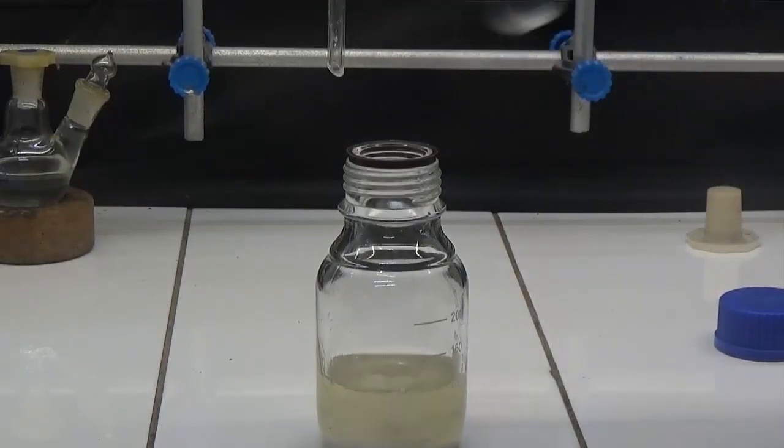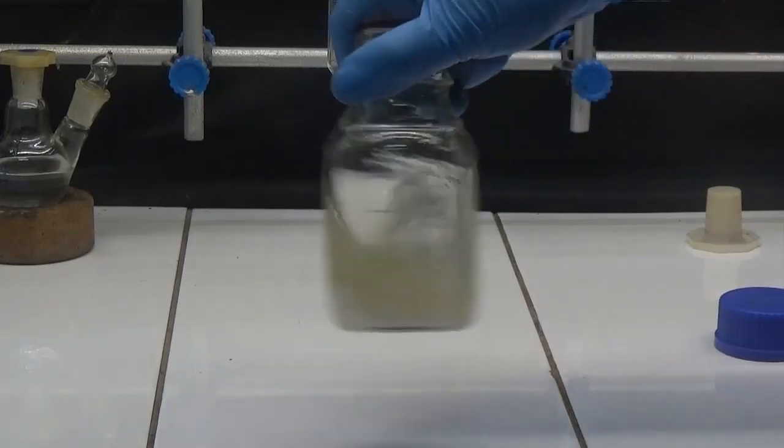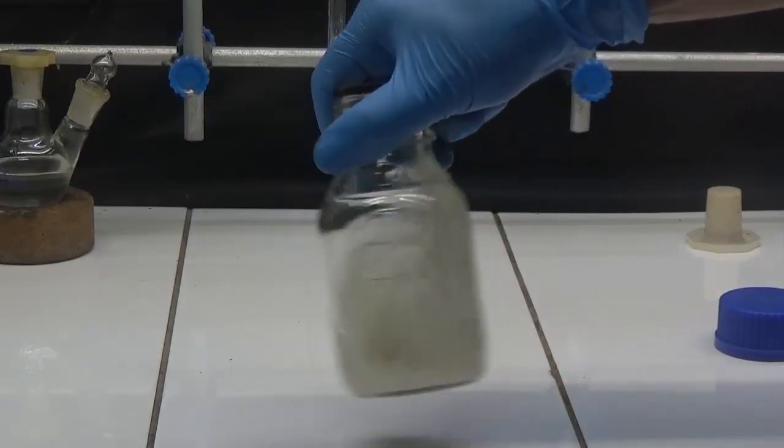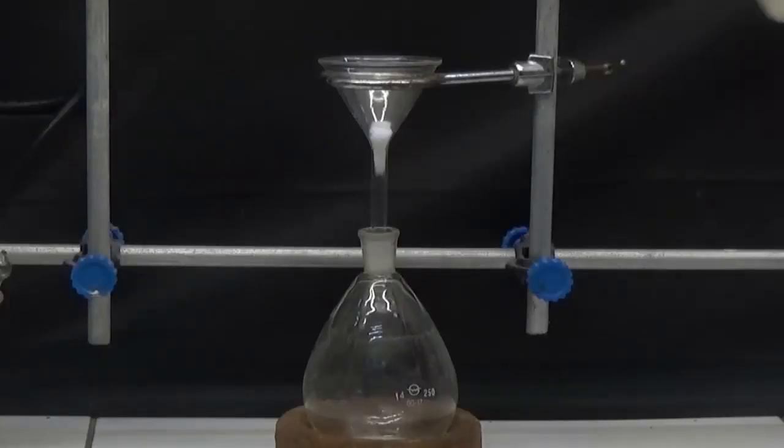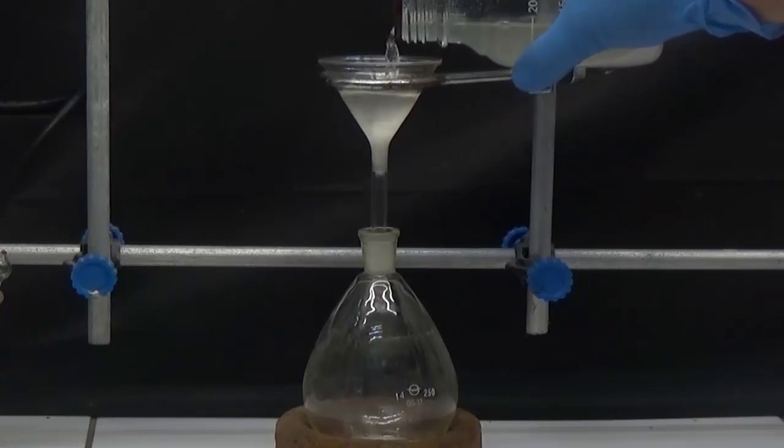Dry with anhydrous magnesium sulfate. Filter to eliminate magnesium sulfate.